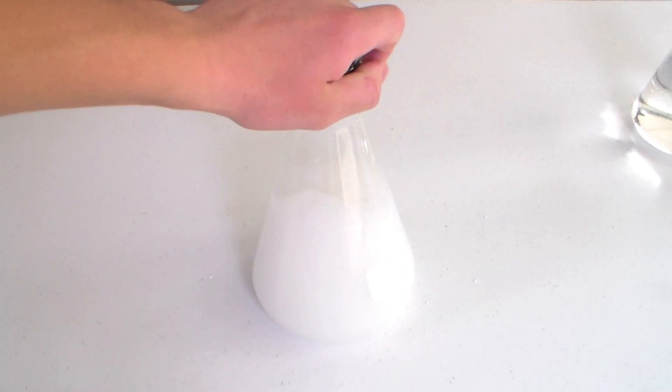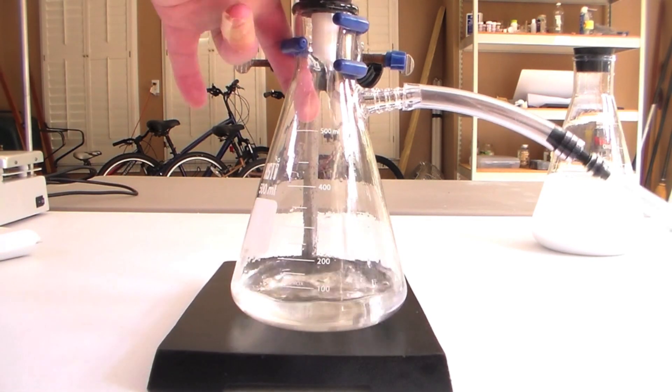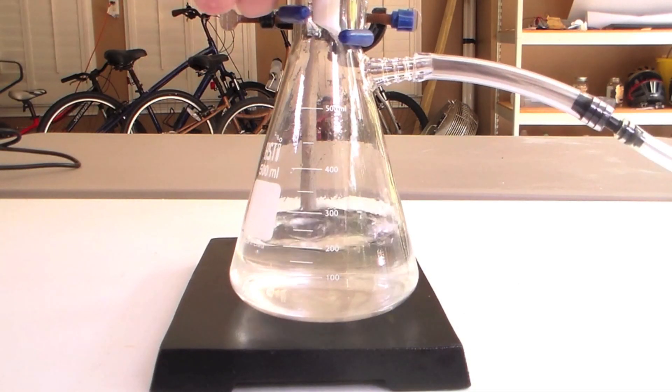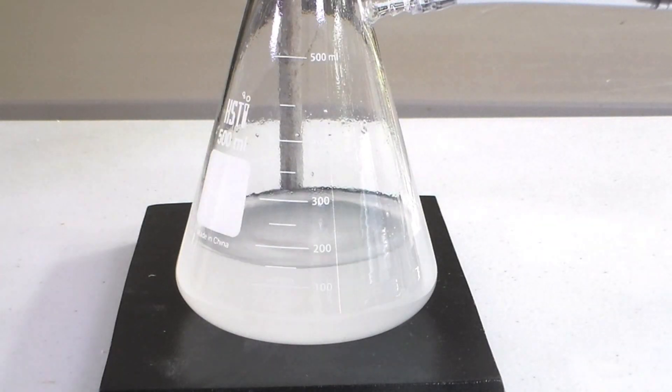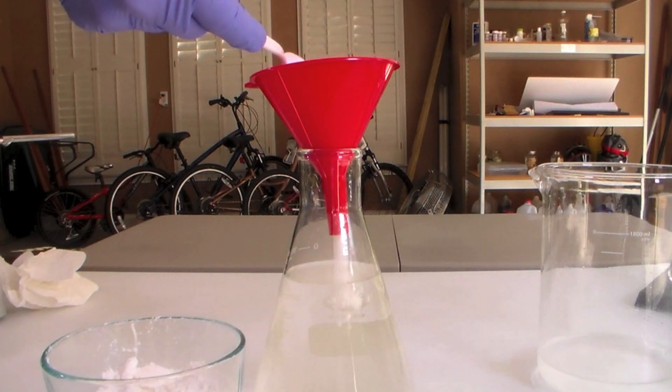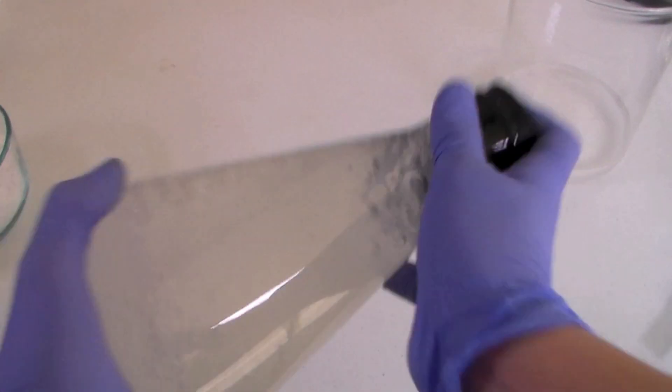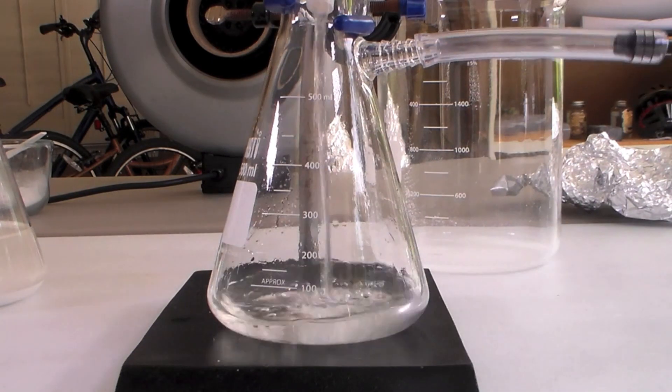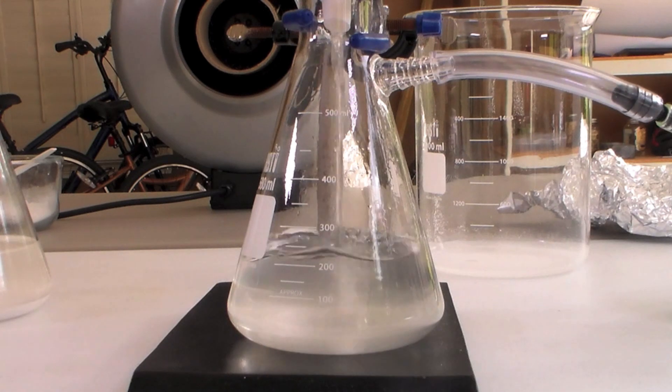Once it's all settled, vacuum filter it to retrieve the ethanol. It's okay if it's a bit cloudy in this step. Now I decided to dry my ethanol twice, but this probably wasn't necessary. It will only be necessary if you don't use enough drying agent the first time.